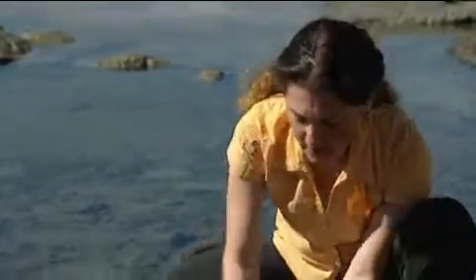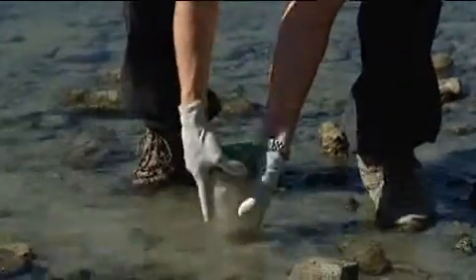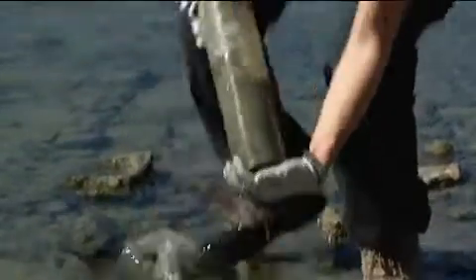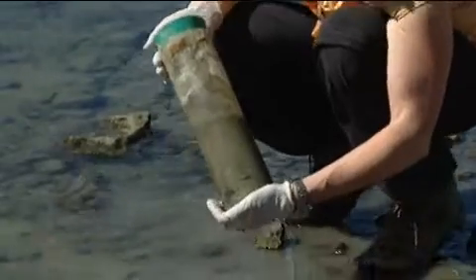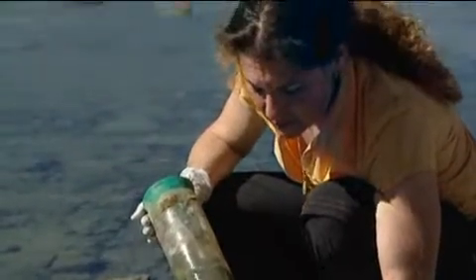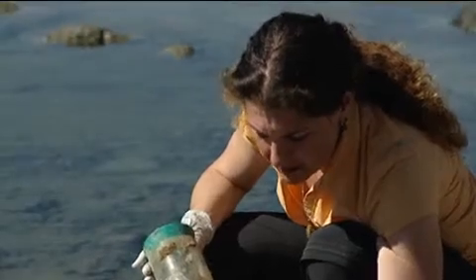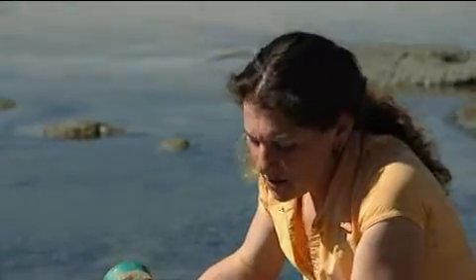And what you'll see, if I do this correctly, is when I take up the mud, it looks homogenous — it looks well mixed. And what I'm going to do is put it in an environment where I can enrich for certain kinds of organisms. In my case, what I'm interested in is photosynthetic organisms, so I'm going to use this mud and put it in a container in the light.